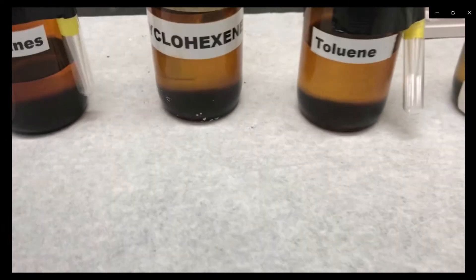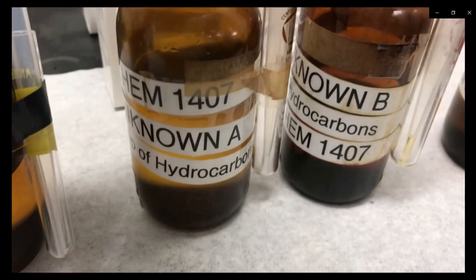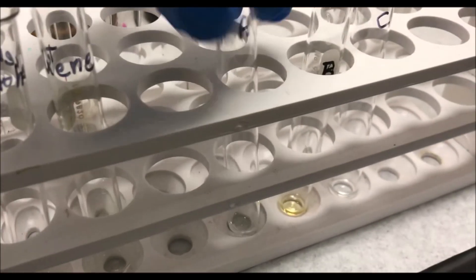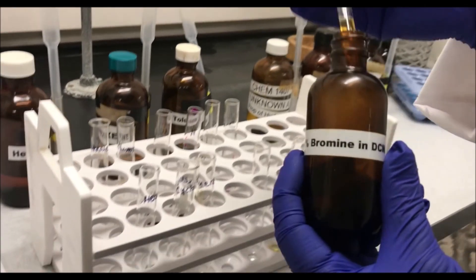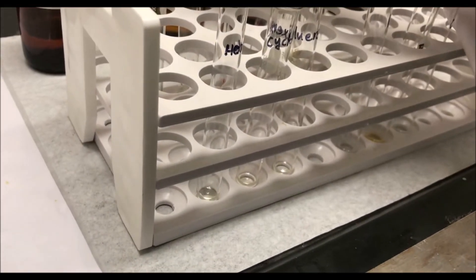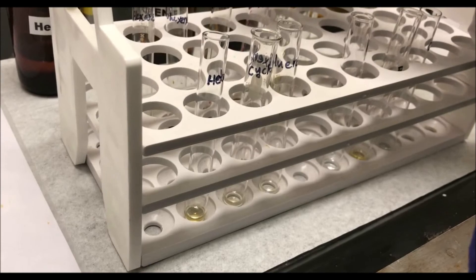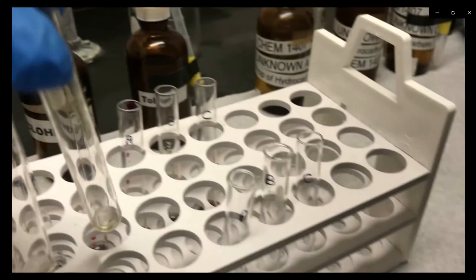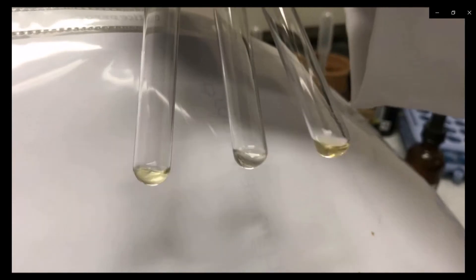Place 15 drops of hexane, cyclohexene, toluene, and the three unknowns in separate test tubes. After adding 15 drops of the hydrocarbon or unknown solution, add three or four drops of 1% bromine in dichloromethane. The cyclohexene tube gives a positive result for bromine, and unknown B also gives a positive result for bromine.